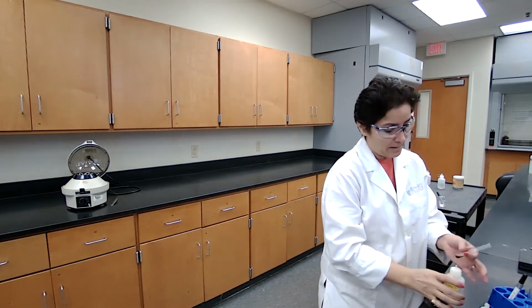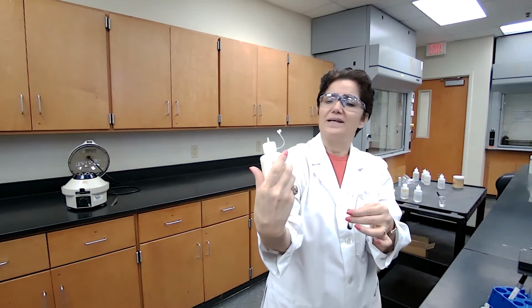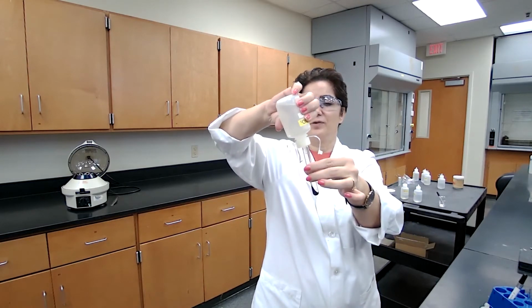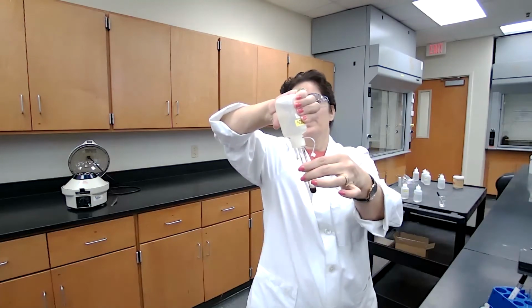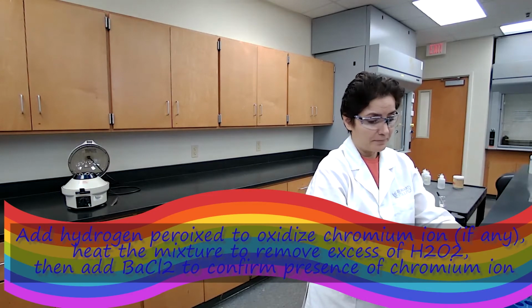Eventually, in part C, I need to dissolve this precipitate. So I'm adding nitric acid to it, for it to start dissolving. So I kind of give it a head start and leave it here for part C.